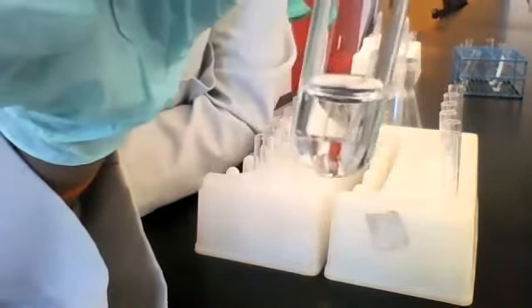It doesn't feel warmer or cooler. You don't see any gas forming, any bubbles or effervescence. There's no odor coming from it. There's no precipitate formed. So no change here.